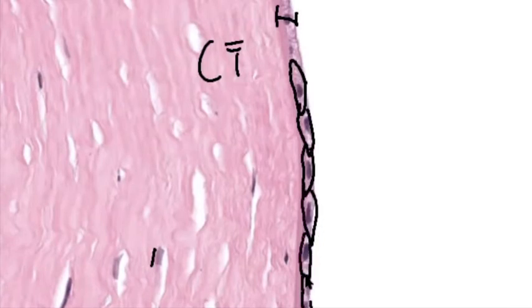So unlike for the connective tissue, where we have to label for the practical the tissue, the cell, and the fiber, for this one it's just naming the type of epithelial tissue it is. The cells are just, in this part, there's no structure. Like when we get to bone next unit, there'll also be structures and stuff you have to know. But for epithelial stuff, it's all just name the tissue straight. These are the answers right here, exactly as they appear in the lab manual, which is the easiest way to answer any of those questions when you're taking your quiz and stuff.